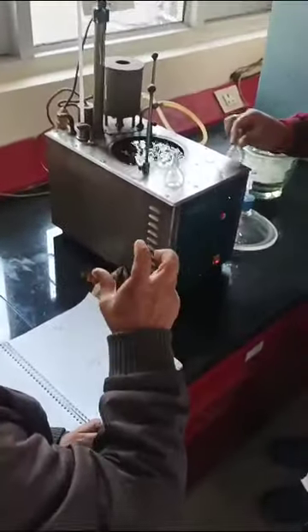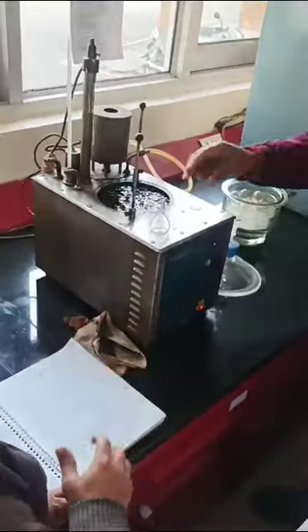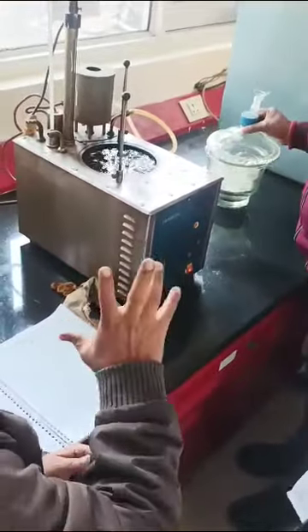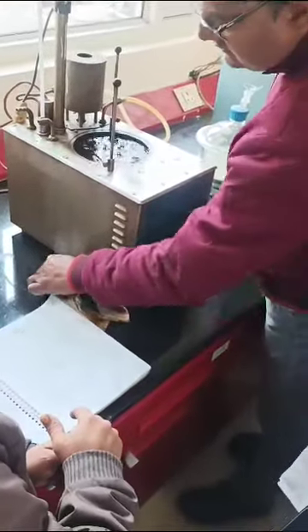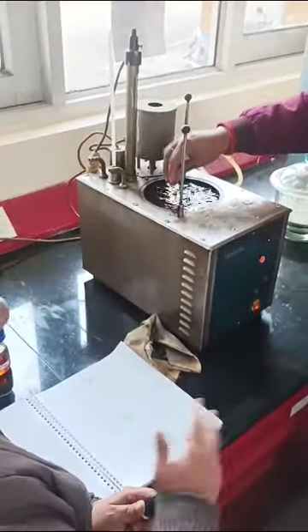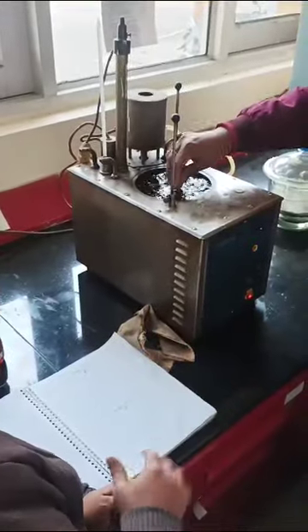So let it complete. Then after that, if we find some time after the calculation, we will do the smoke point. Smoke point is very important in ATF, aviation turbine fuel. See, smoke point is also an index which can tell you the presence of aromaticity. If the smoke is high, there is lots of smoke, then definitely you come to know my fuel is high in aromatics. If the smoke is low, then it is not free from, but low in aromatics.